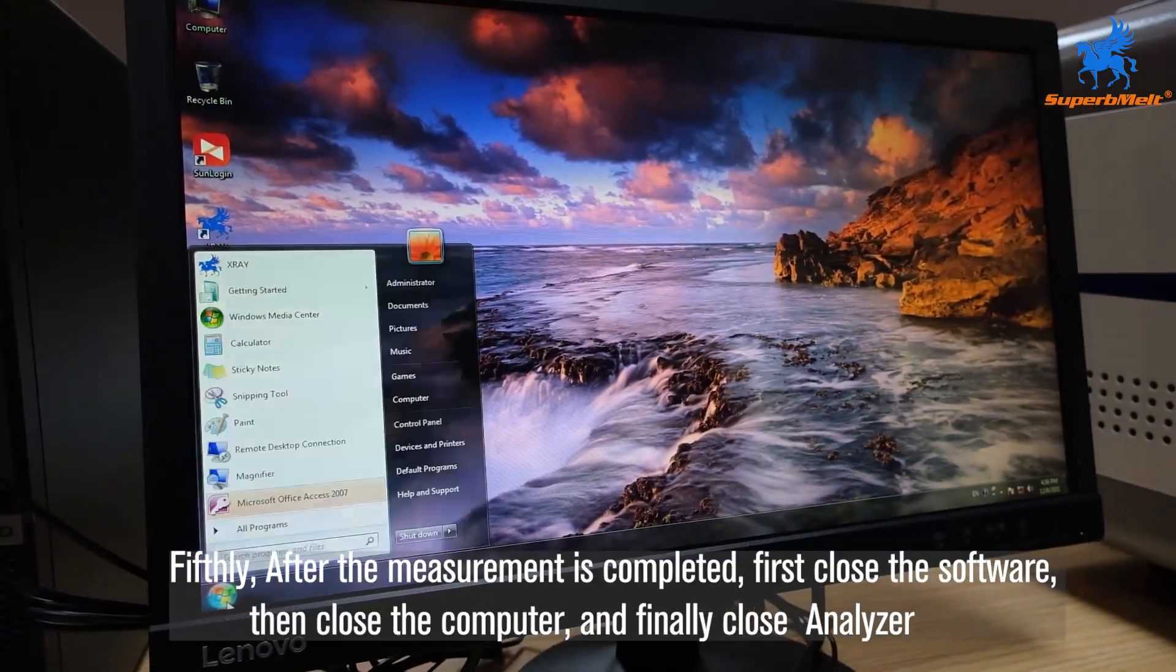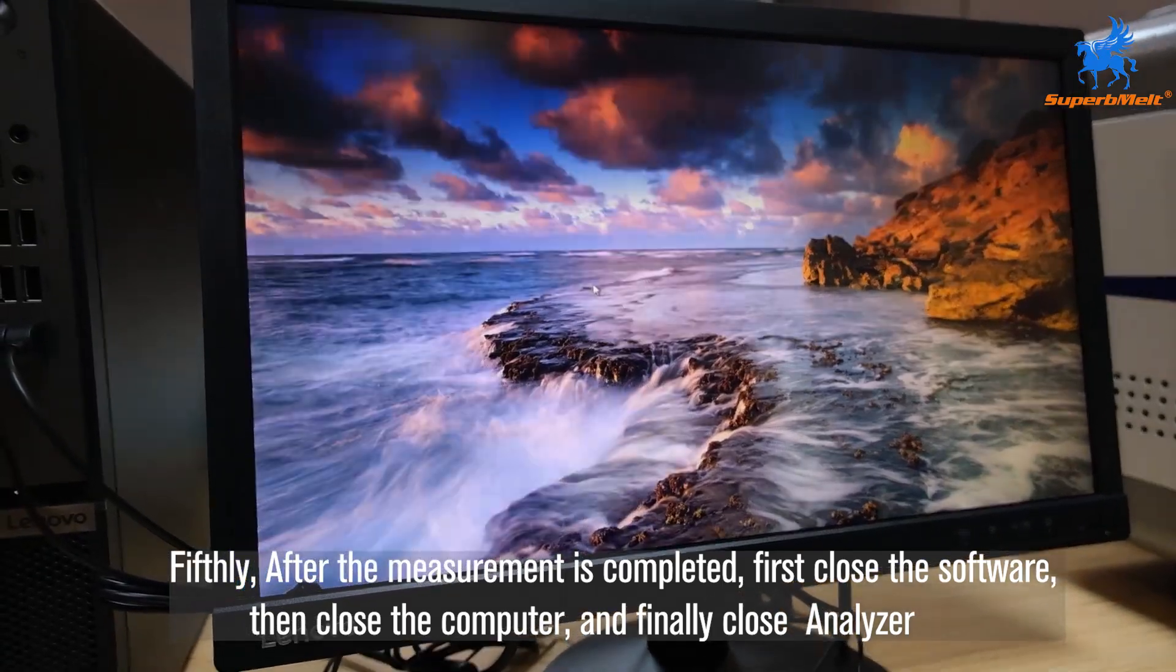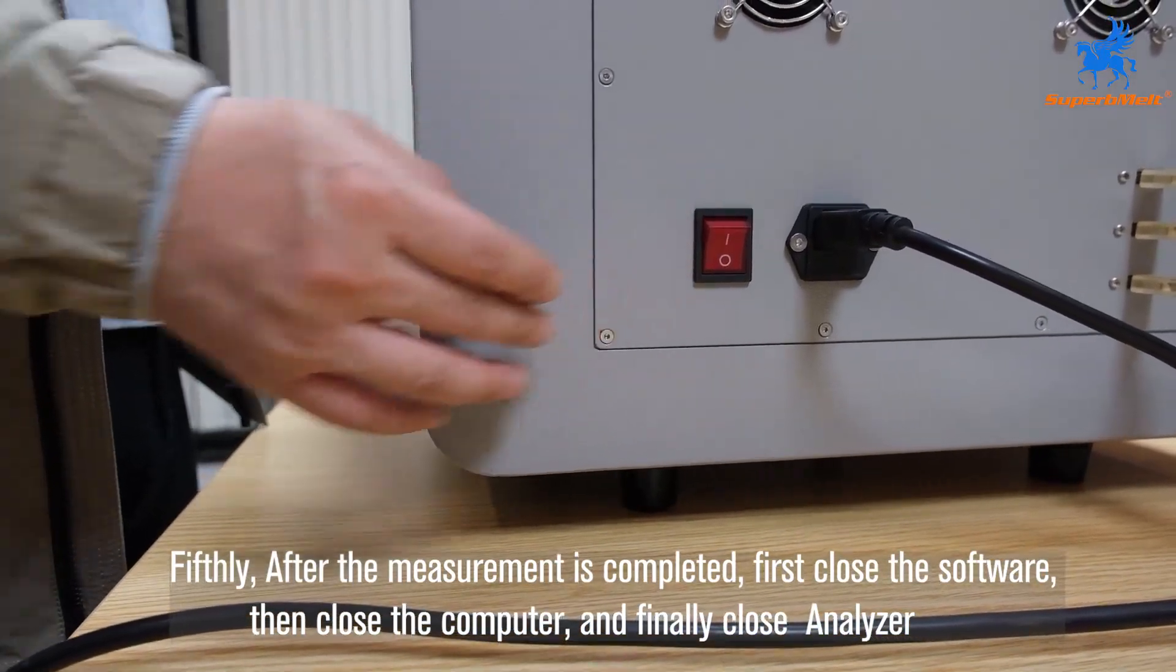Fifthly, after the measurement is completed, first close the software, then close the computer, and finally close analyzer.